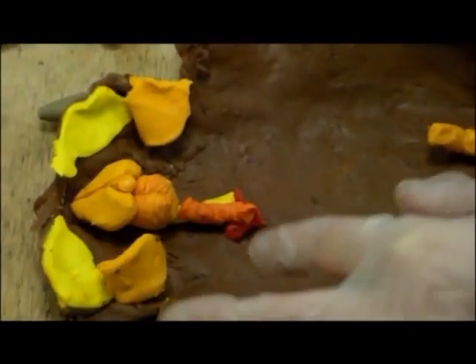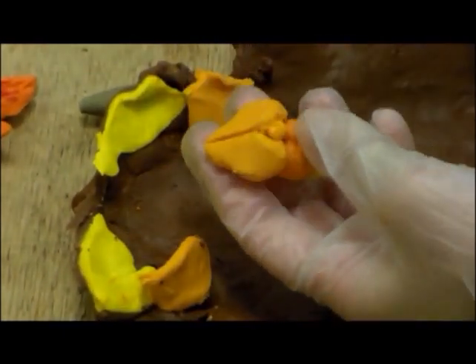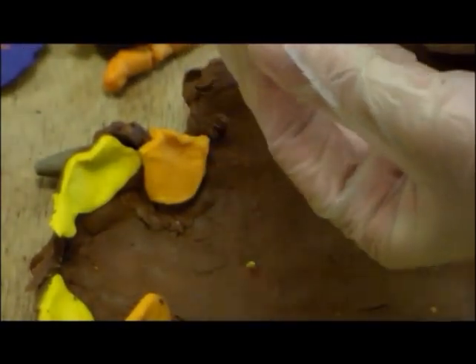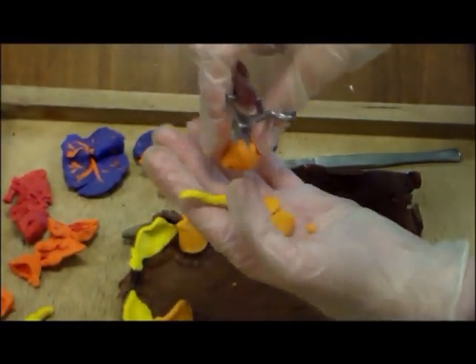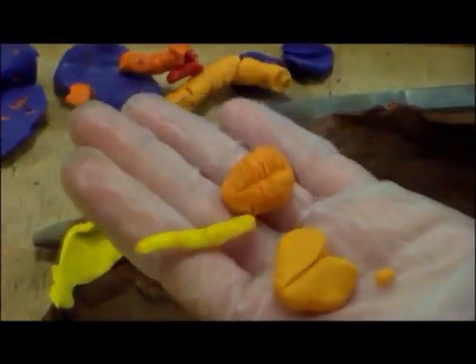To dissect the brain you will need to cut through the skull carefully, as the brain tissue is very soft and can be easily damaged. The structure of the brain consists of the olfactory bulb, cerebrum, pineal gland, and cerebellum.